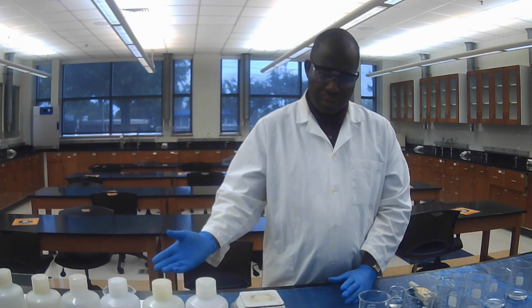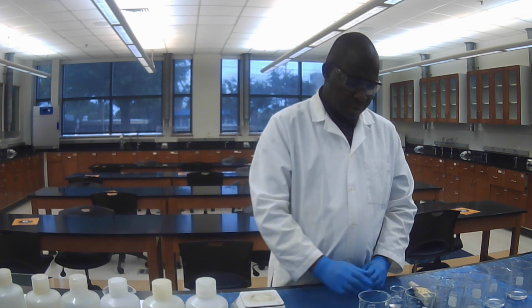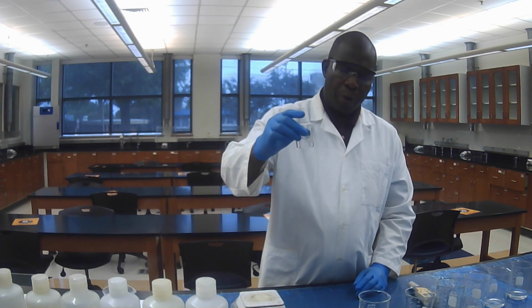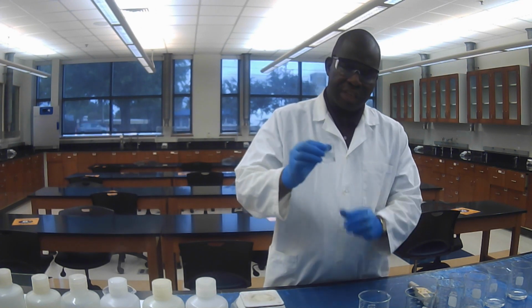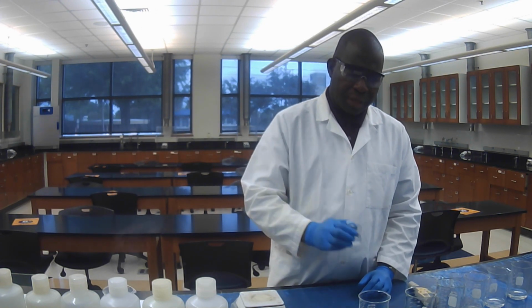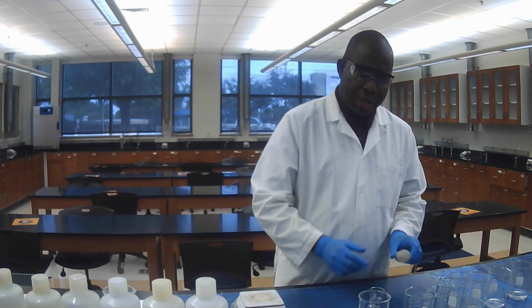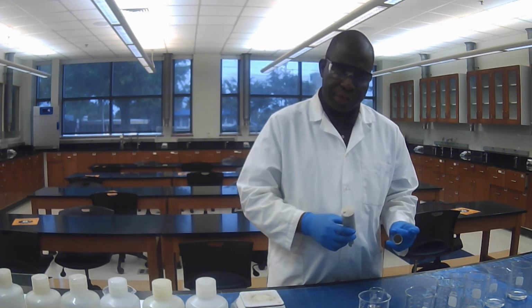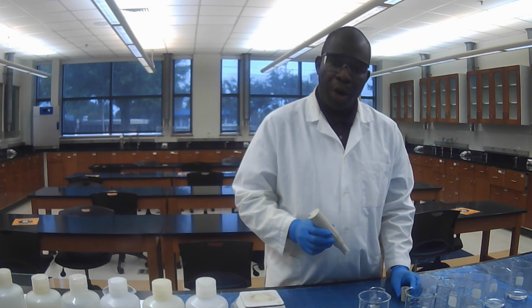Now, while you are waiting for the water to cool, obtain about 25 milliliters of DI water in a 50 milliliter beaker. I have done it. This is my 25 milliliters of DI water inside a 50 milliliter beaker. What I'm going to do is to measure the pH of the boiled water and the unboiled water.